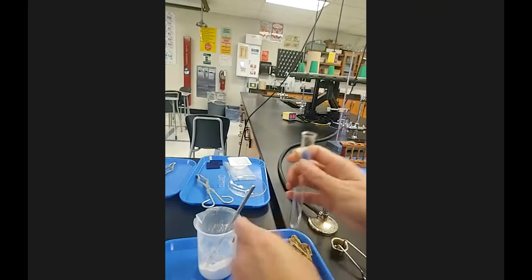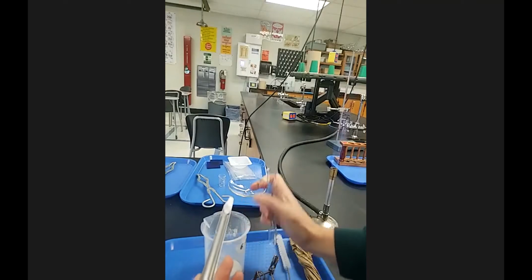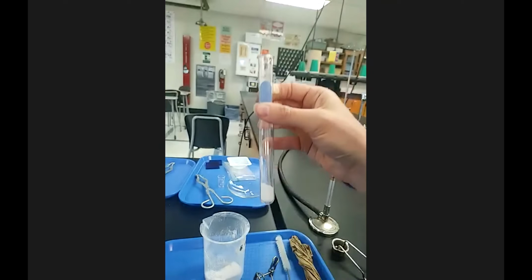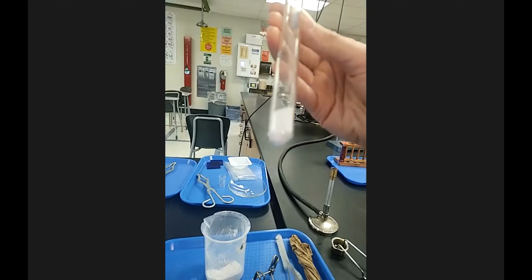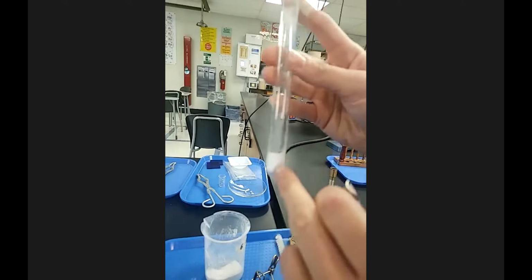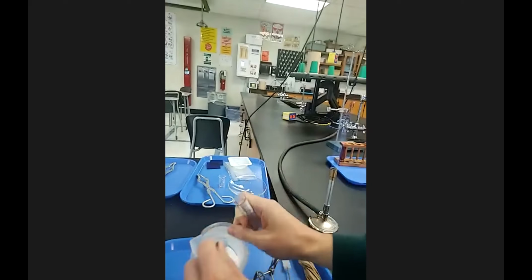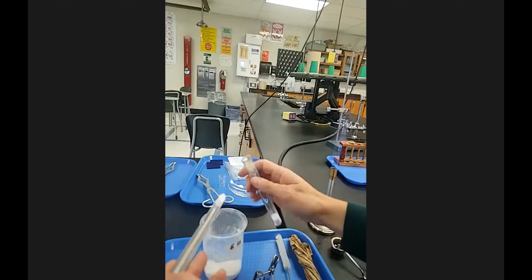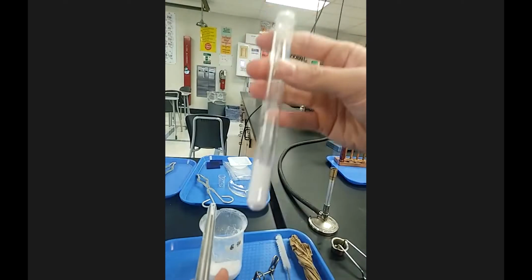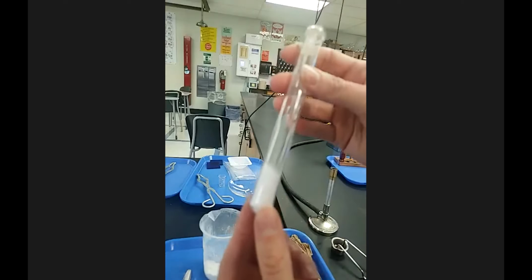And I'm going to add some sodium hydrogen carbonate. It says to add a couple scoops of it. So scoop with a scoopula, and then putting that in the test tube. This is probably enough, but I'm showing what a scoop in a test tube amount is, because sometimes students are like, is that enough? Do I need more, less? It says, I believe, 1 to 2 scoops. I'll add 2, and this is more than enough to see what we need to see. Just so you guys are aware, you don't need a lot.